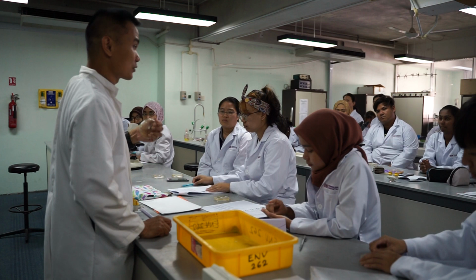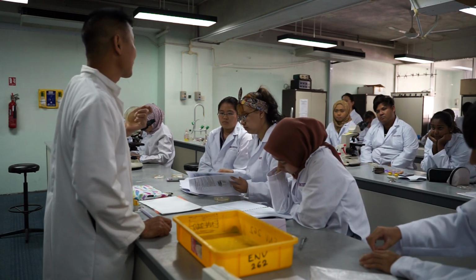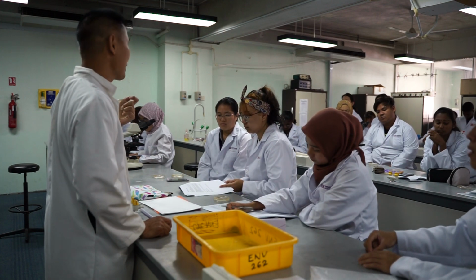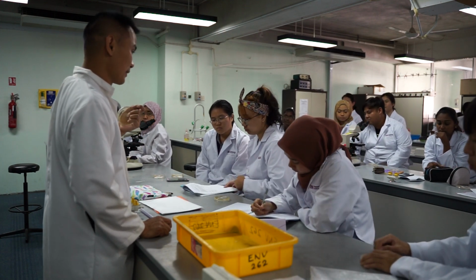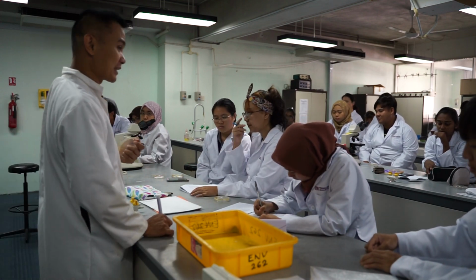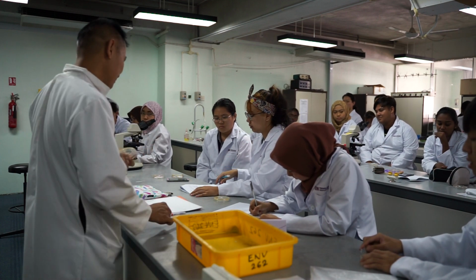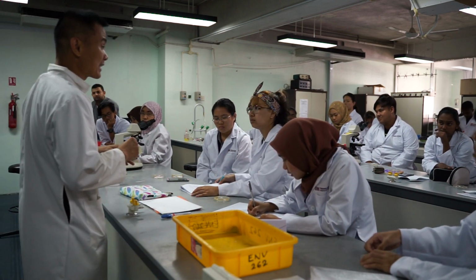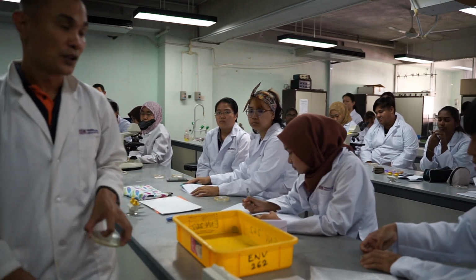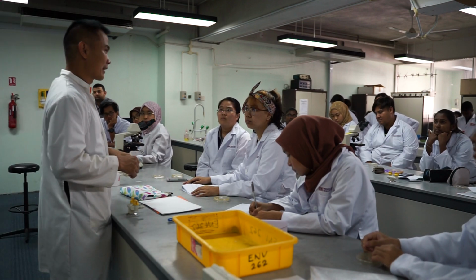The next procedure is to know what bacteria they are. Gram staining can tell you about the cell wall. It can tell you whether the cell wall is thick or thin. And the next procedure is you can actually identify using DNA, which you're not going to do unless you take forensics. So what gram staining does is you are going to put two different kinds of dye.